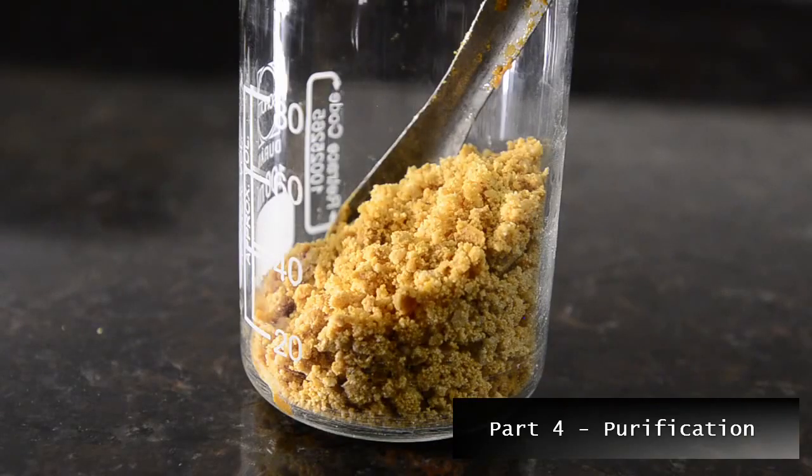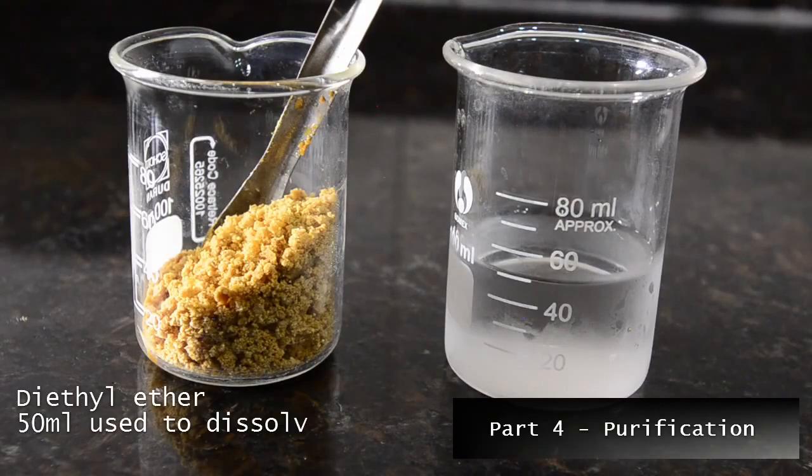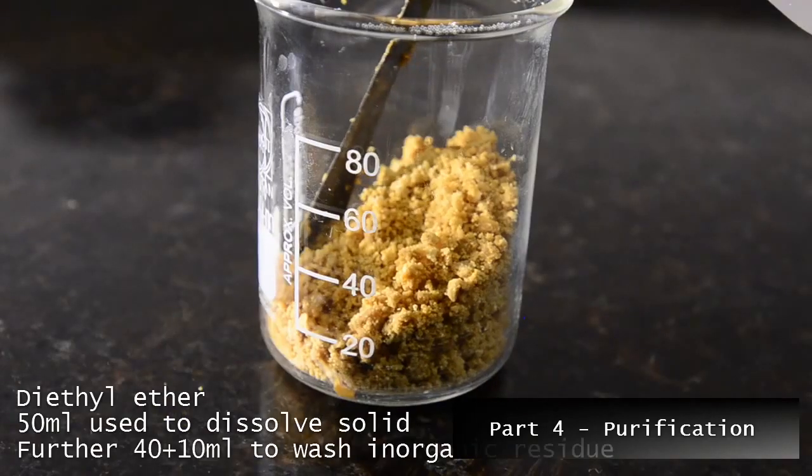Mandelic acid is soluble in diethyl ether, whereas the inorganic salts are not, so we can use this to extract our product. Add 50 milliliters of ether to the solid obtained. You'll see a large portion dissolving immediately.